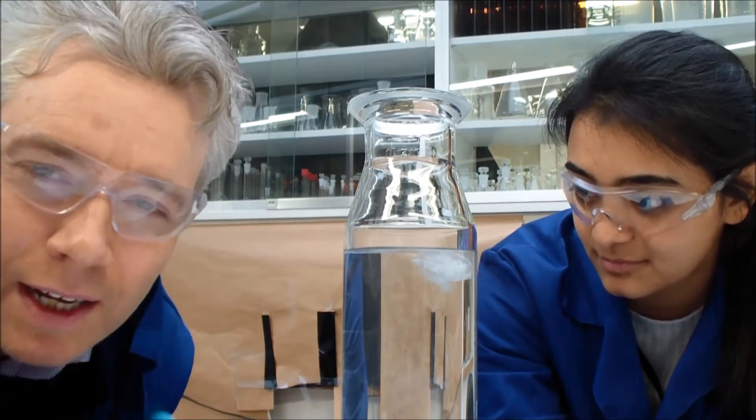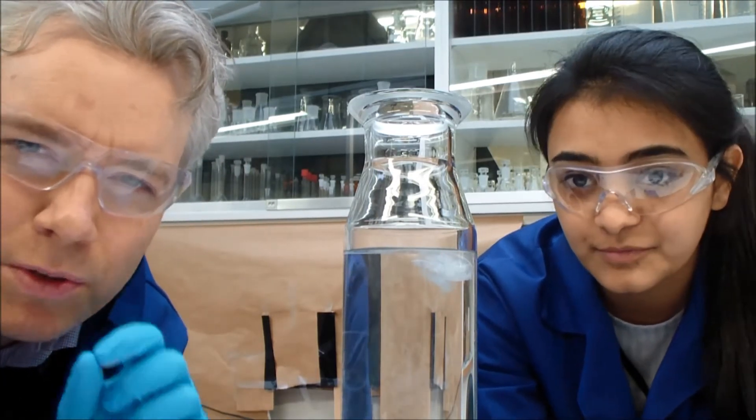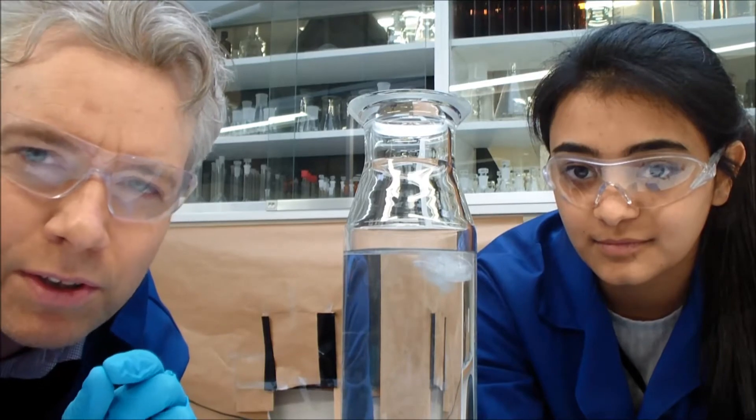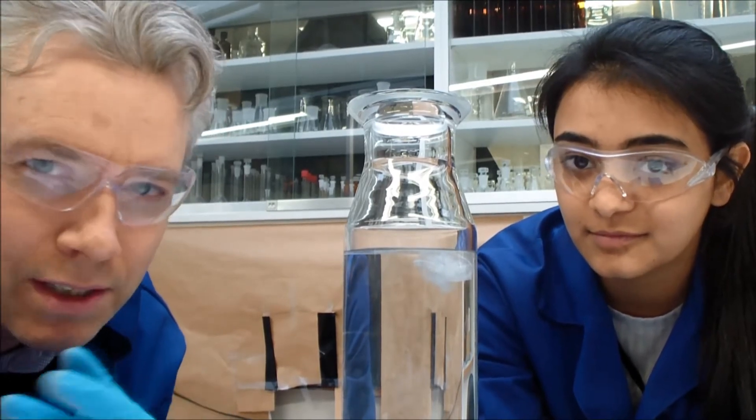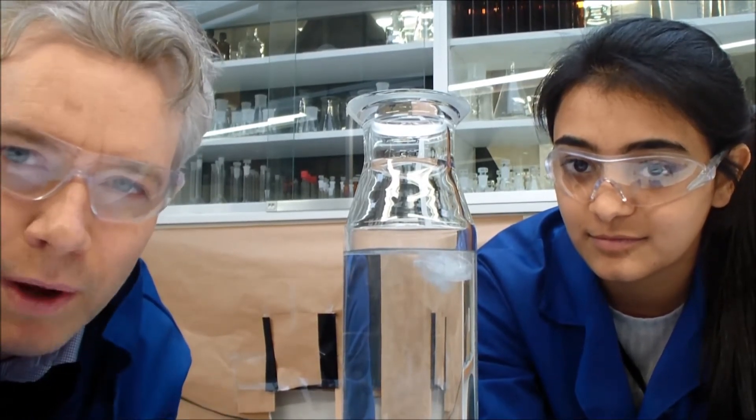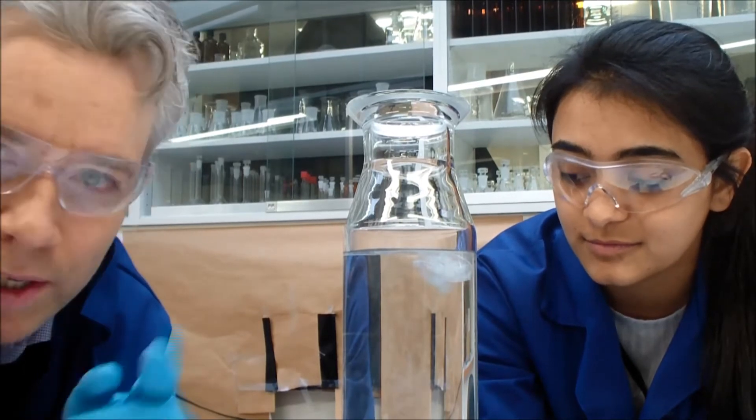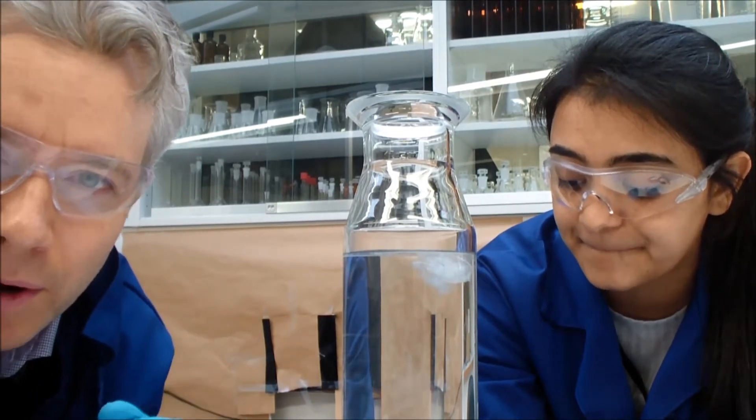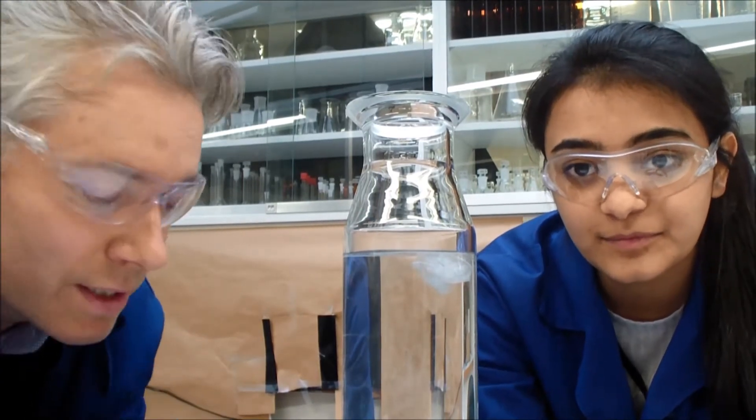They're actually a little bit below the surface. What we're going to do next is introduce a small amount of turbulence, just like a current or wave motion. This has a propeller at the bottom. We're going to start spinning it and see what happens.